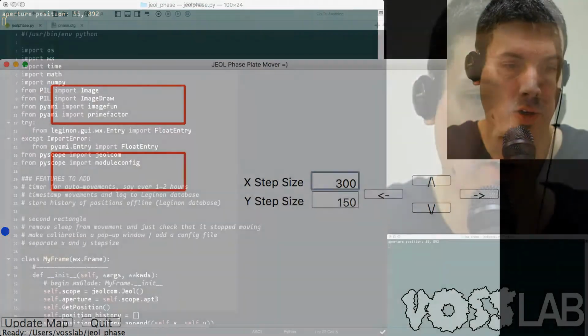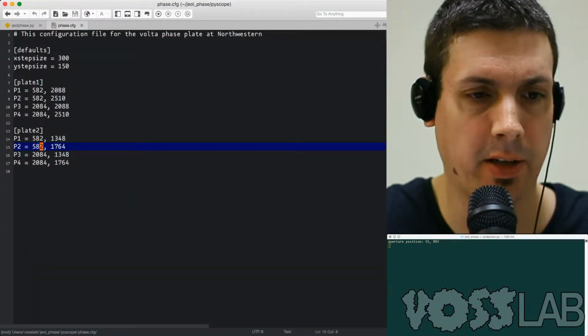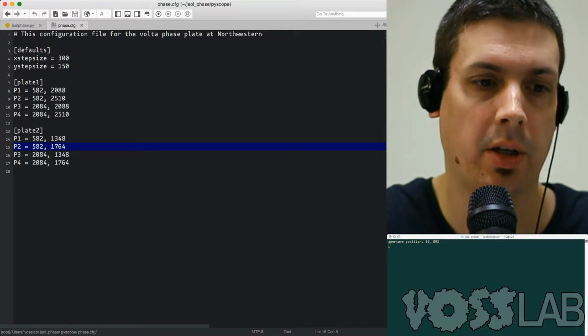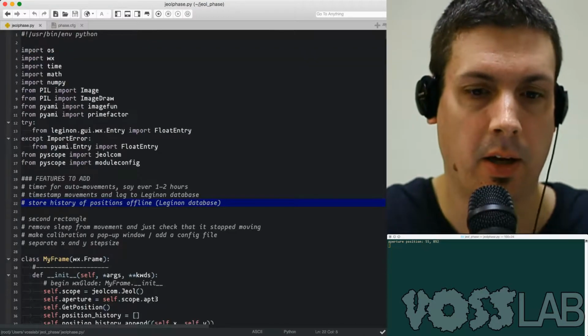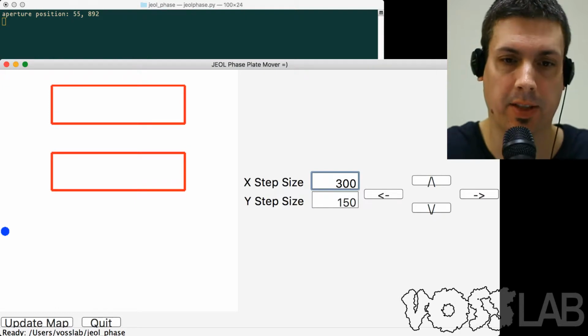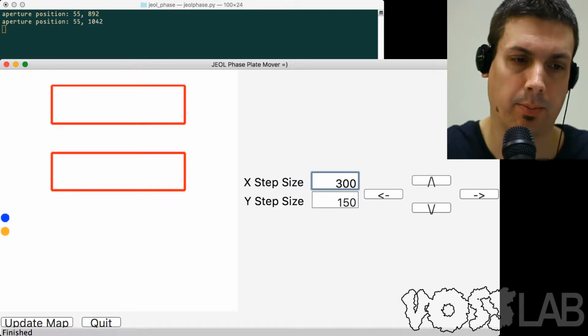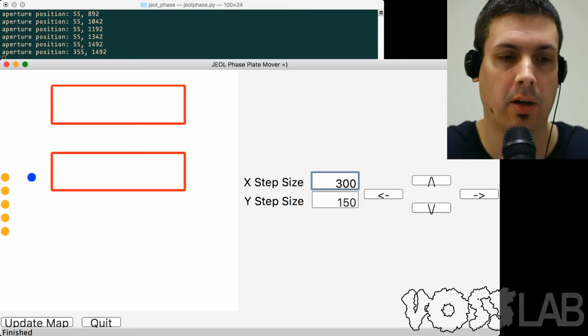But why don't I show you the configuration file here. Basically, you're just providing the different points for the 4 corners of each of the rectangles, and then it draws that on the screen. You can also set up a default X step size and Y step size. When using the program, we found out that we needed different step sizes in the different directions because in terms of how far the beam moved, it didn't move nice and clean.